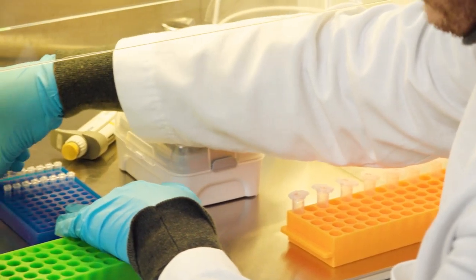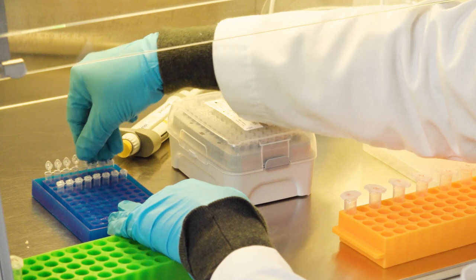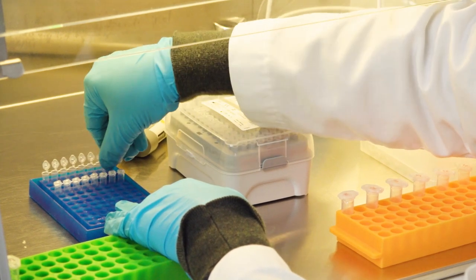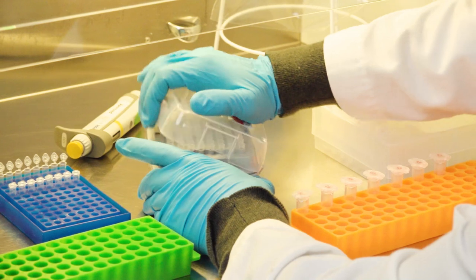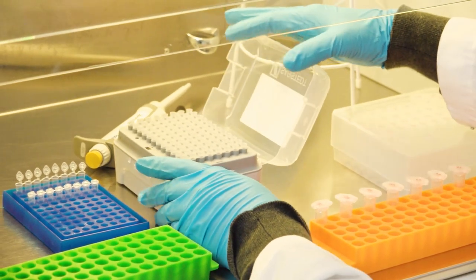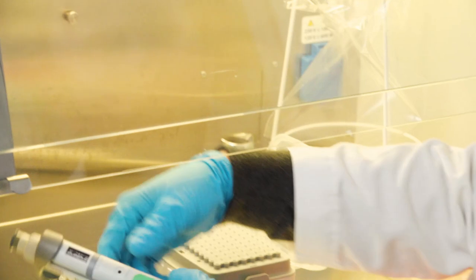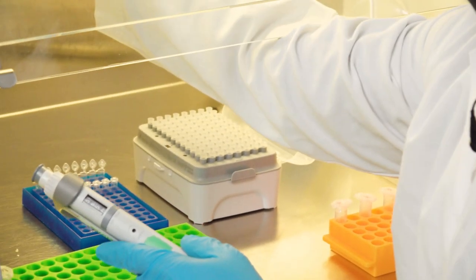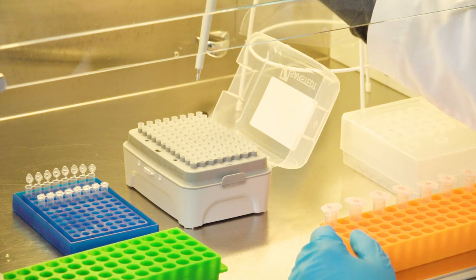Then again, I open the PCR tubes. I open the box, align those two things. I take the pipet, check it's the right volume I want to use.